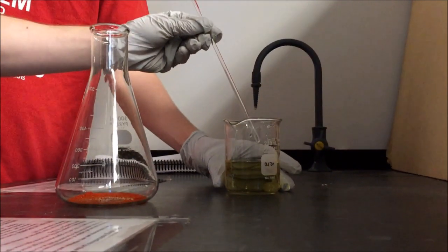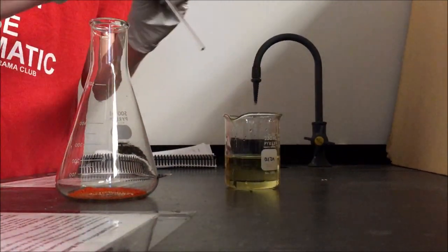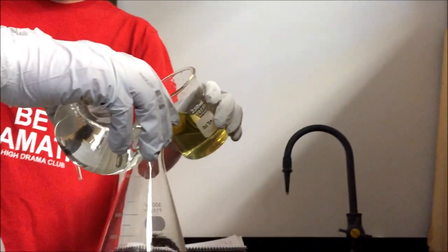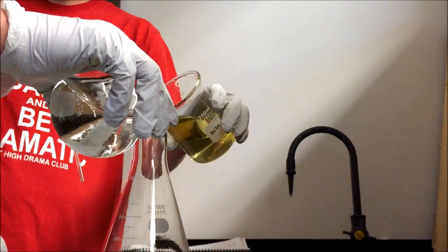Just hold this and then get ready to have this. So we're going to start pouring it slowly. Yeah, ready, ready, you ready? Loose, okay, go.